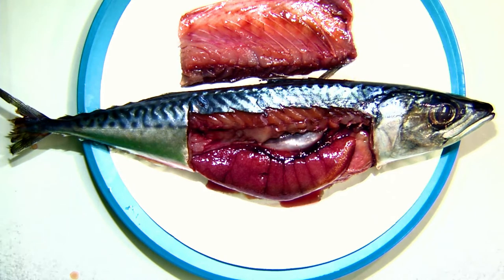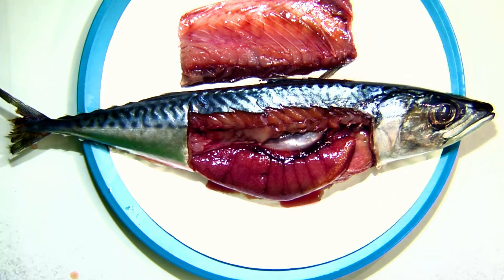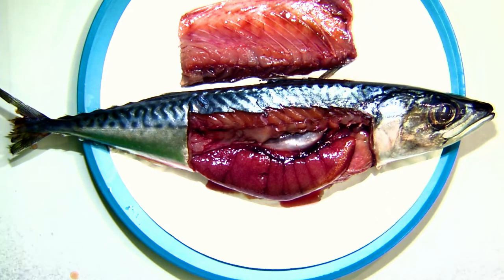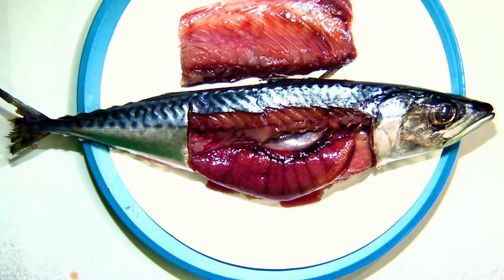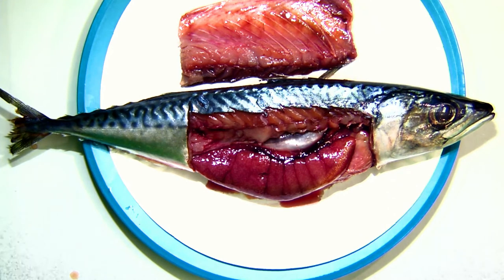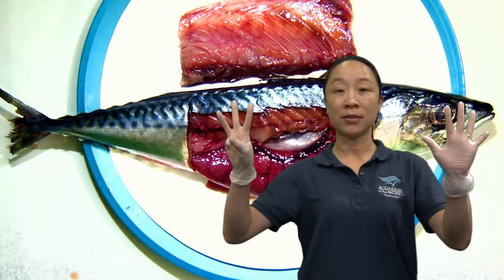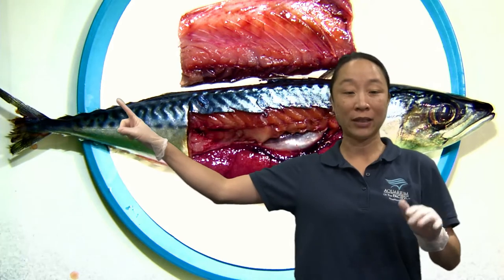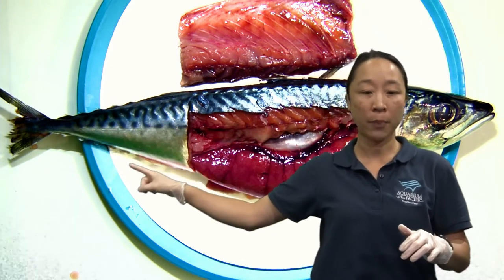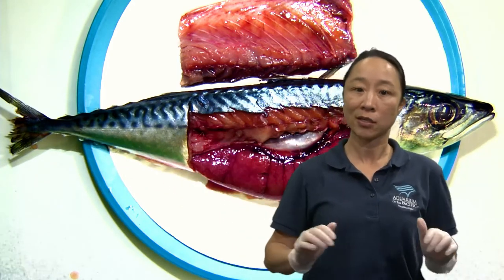Arnoldo is asking: how many fins does a mackerel have? We counted the tail, two side pectoral fins, and two dorsal fins — that's five. It also has about three fins on the bottom, making eight real fins. Then there are the finlets — about five on top and five on the bottom, so ten finlets. So there are eight main fins plus ten finlets — a lot of fin things happening to this fish.